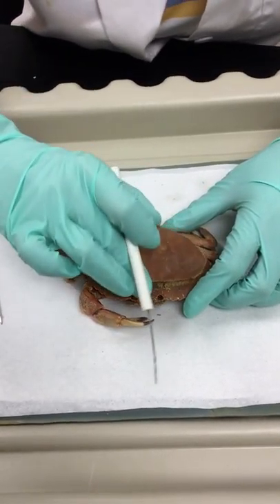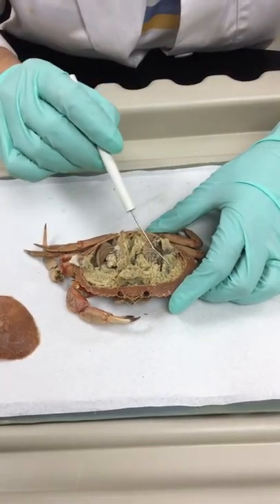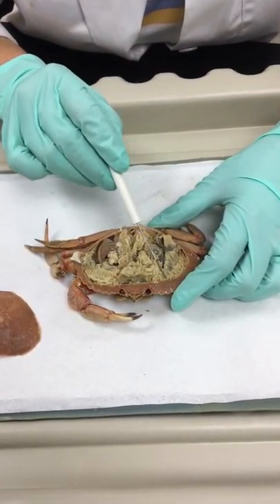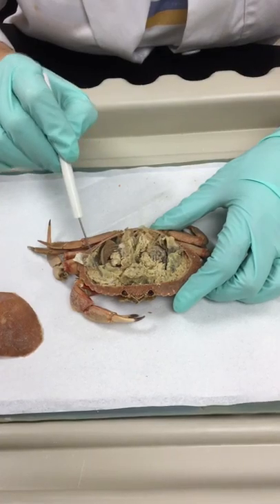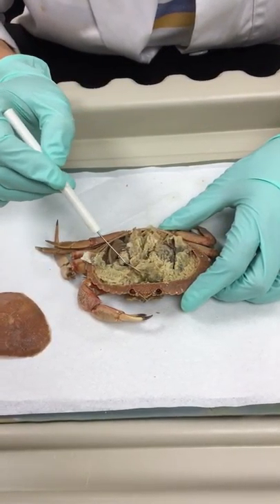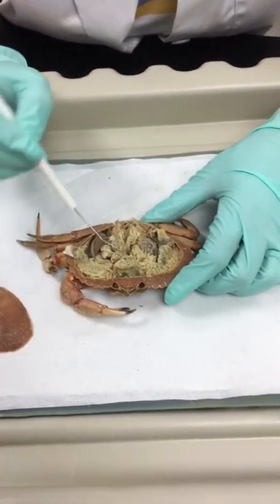Once we've removed the carapace here, what we can see inside of this male crab is the hepatopancreas — this digestive gland right here. We can also see the stomach right here, so that's this structure. This is the cardiac stomach.